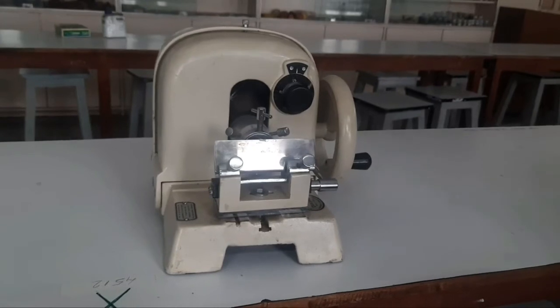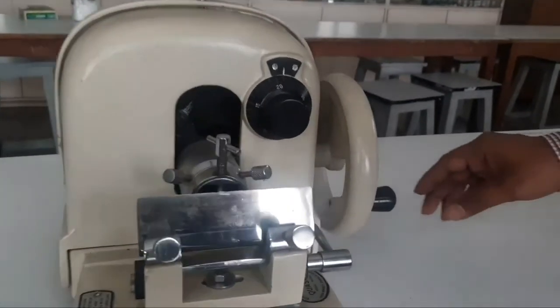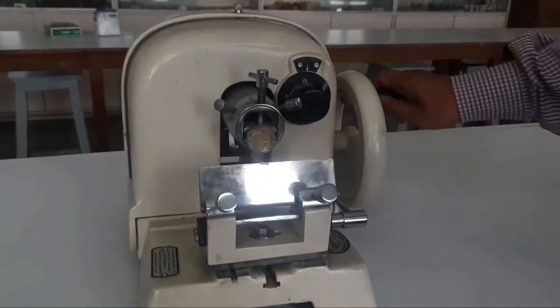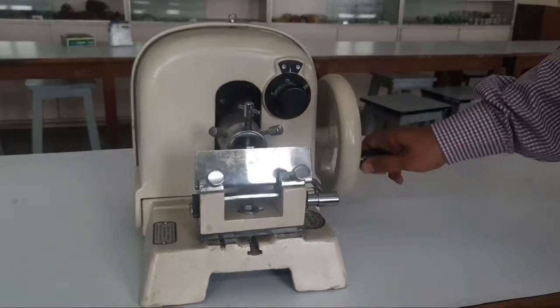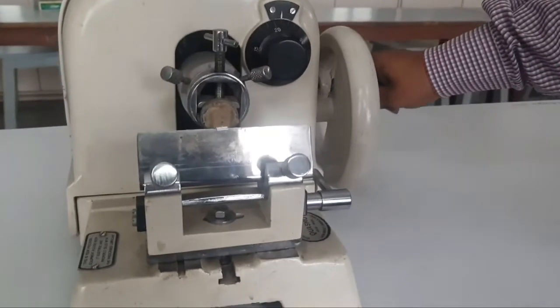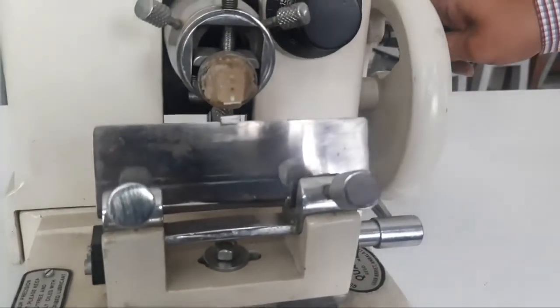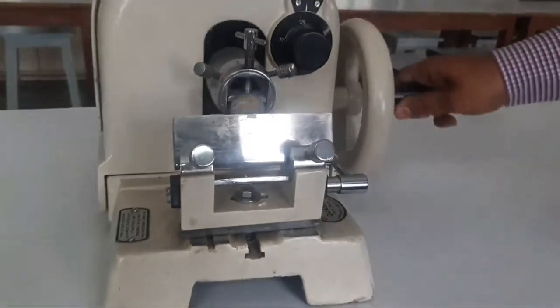This is the microtome. We use it to take thin sections of plant material — that is root, stem, and leaf. Most of the permanent slides of TS, LS, and VS of plant material are prepared in our department.